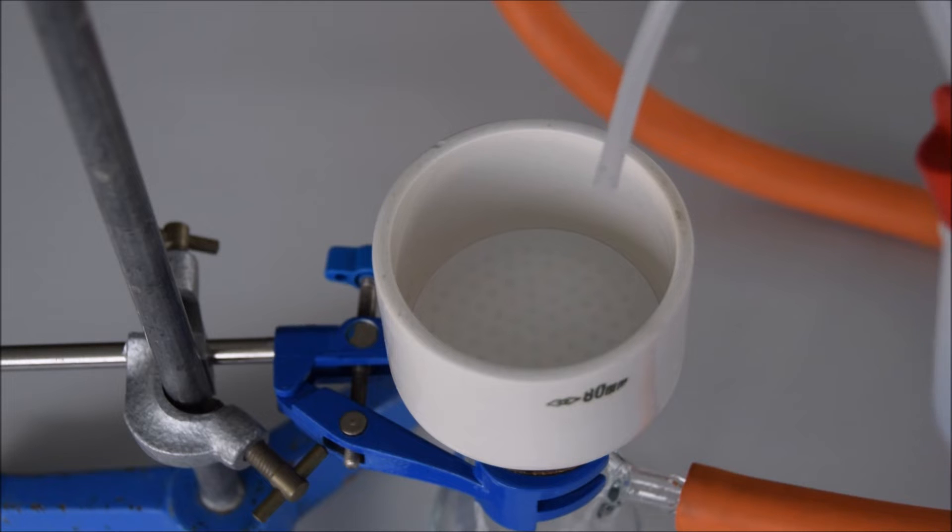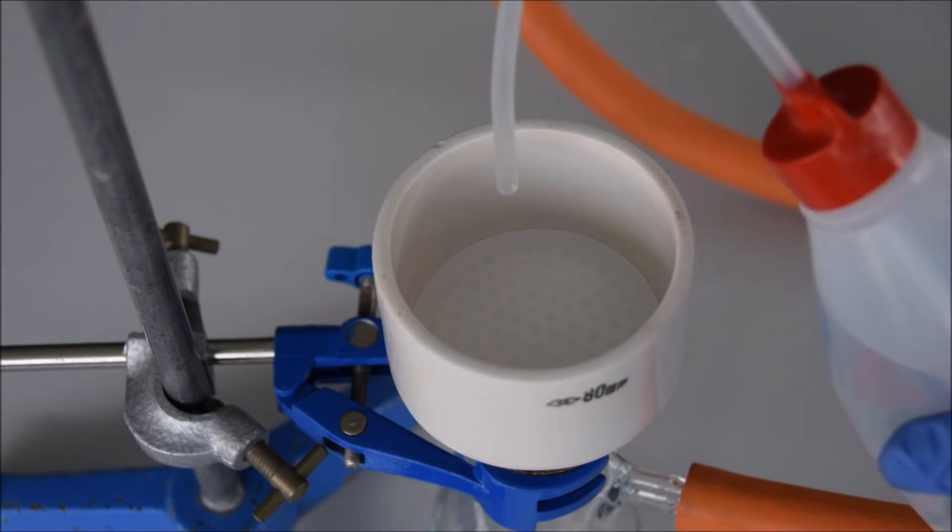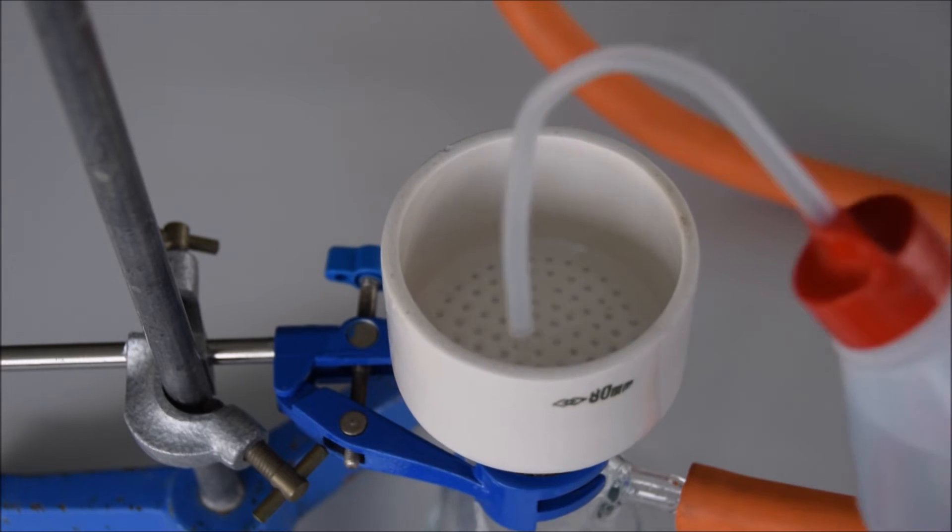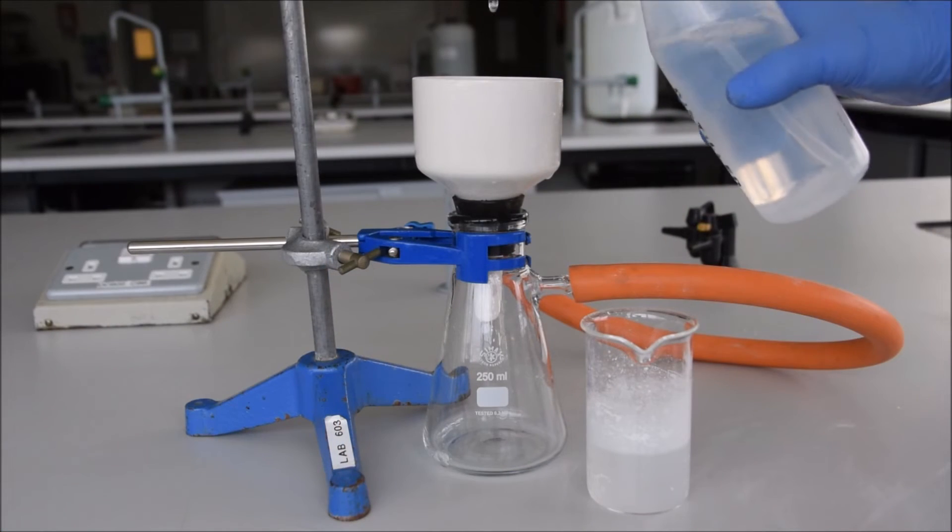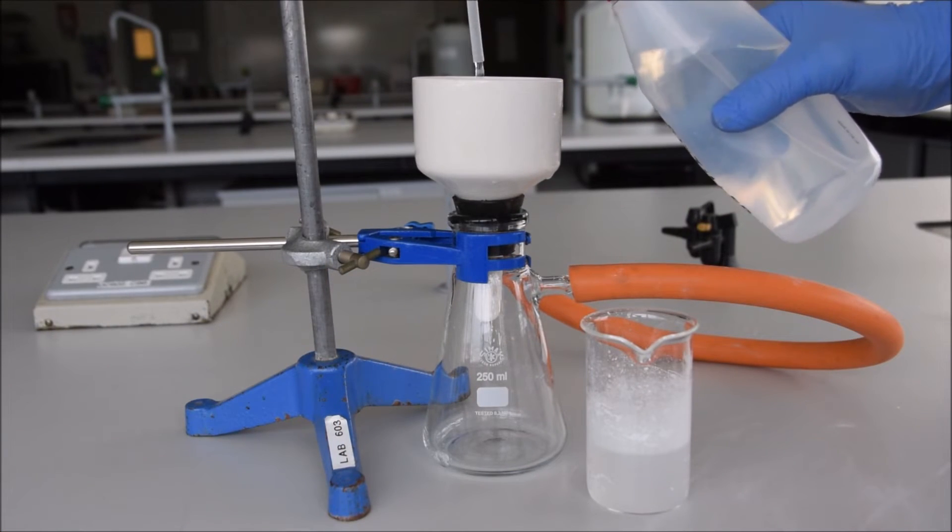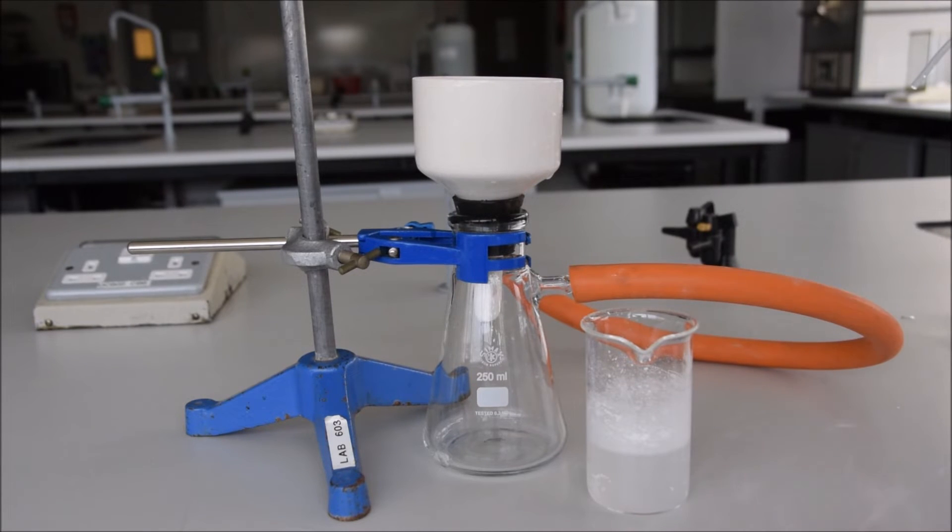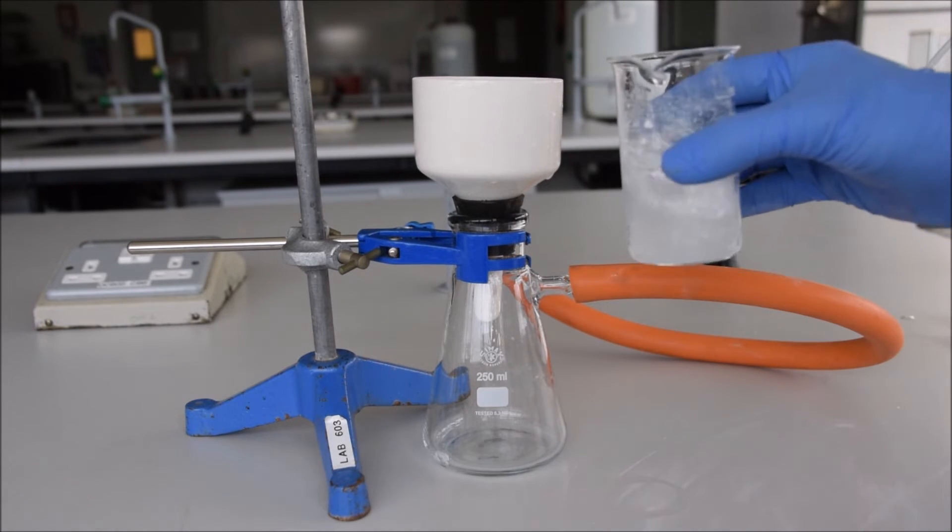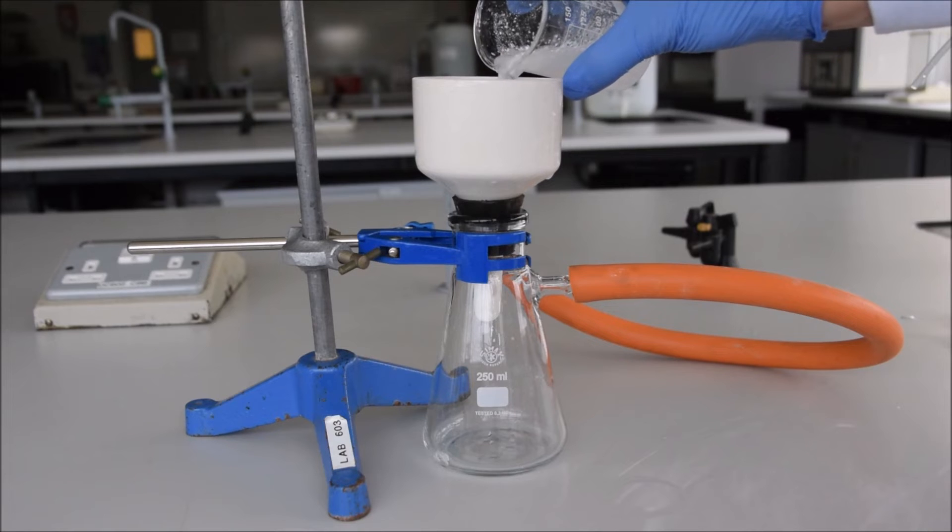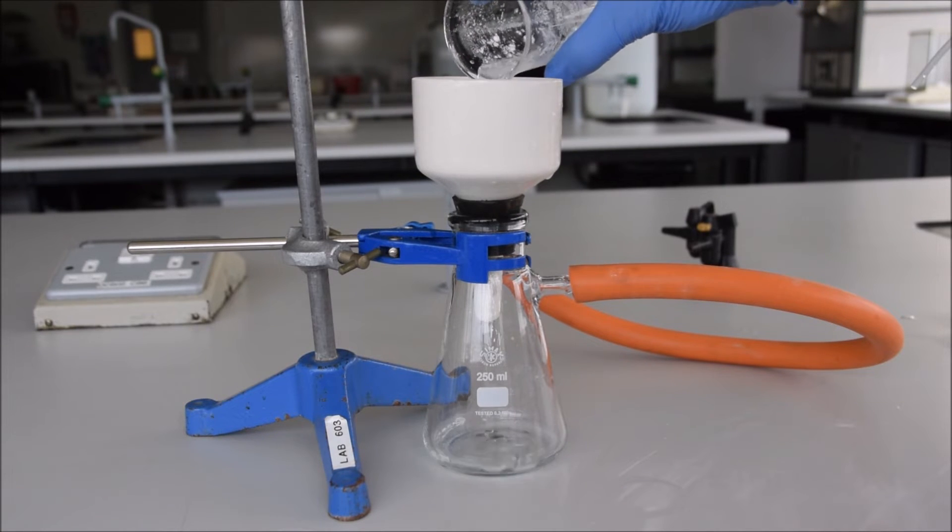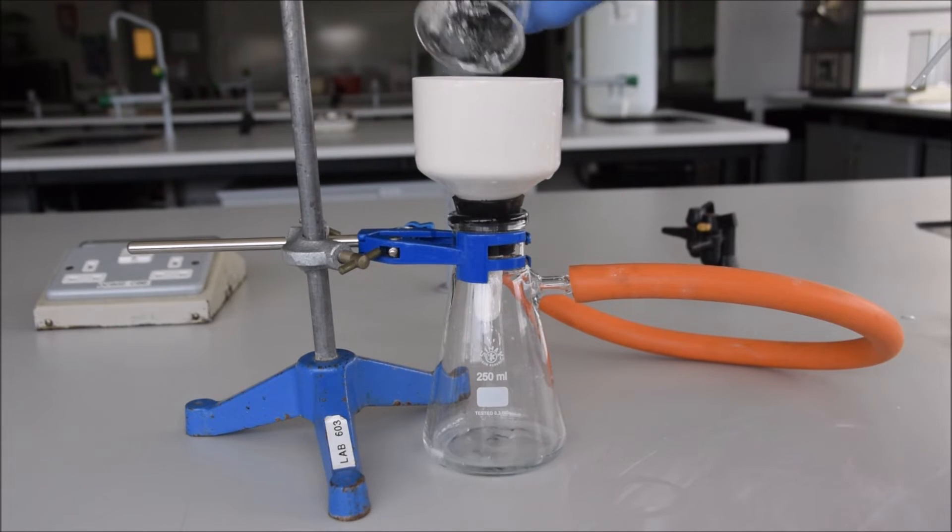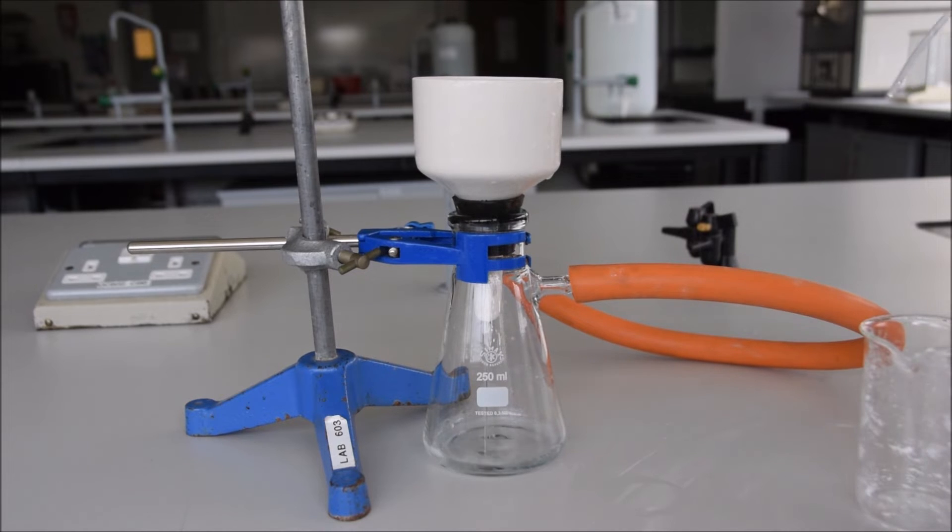That way it's guaranteed not to lift up the sides, and finally by pouring it in gently you're guaranteed good results. Well, almost—let's see what happens. From the side, moisten the filter paper with a little bit of liquid, the vacuum is on, and then get ready to pour in your mixture. It's worth swooshing it around a little bit first—swoosh being the technical term—that way you ensure that more of the solid makes it over and you need to use less liquid to wash out the beaker the second time.